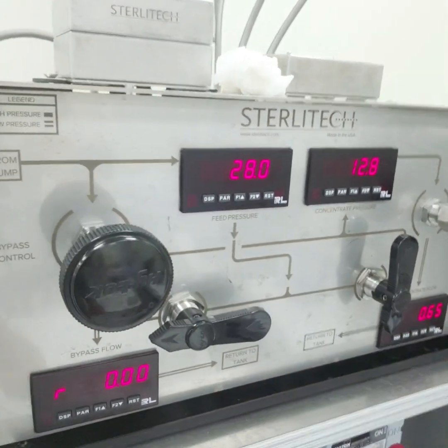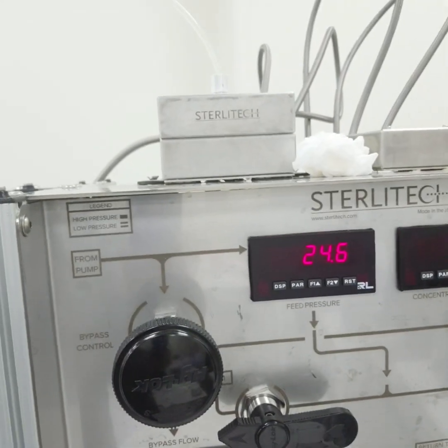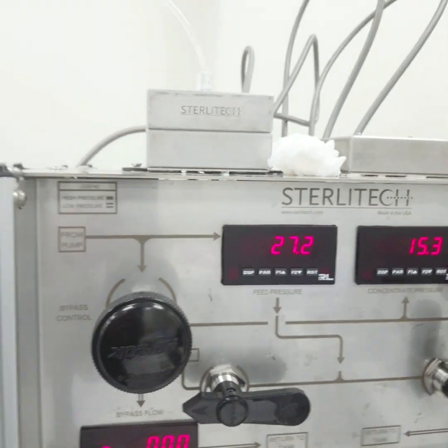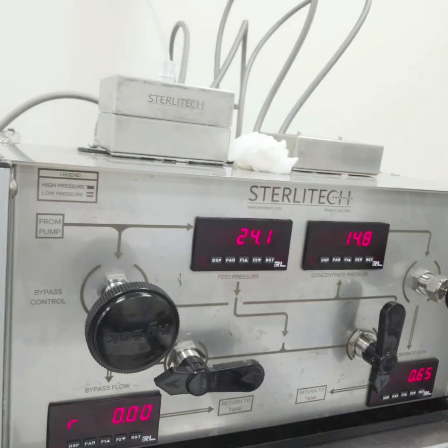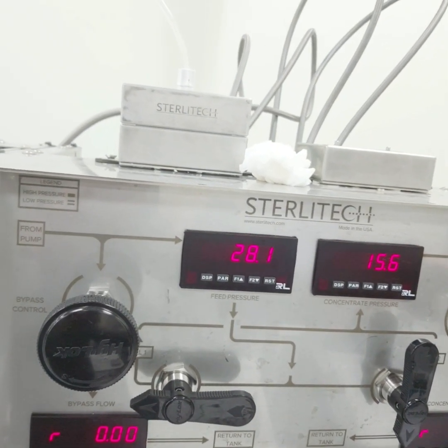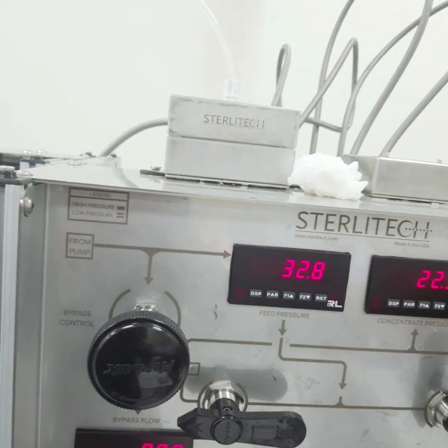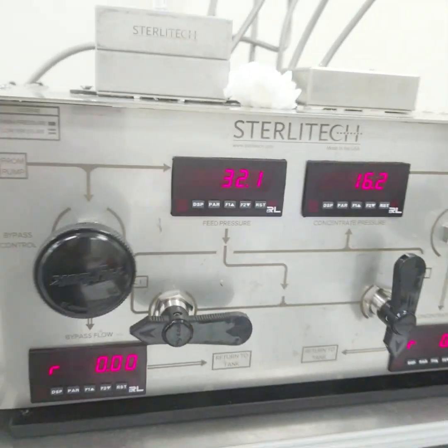And here you can see there are two digital signals. Here we are operating in psi, so 14 psi is equal to 1 bar. Now we are operating at 2 bar, which is equal to 28 psi. From here we are not operating this module, so we are controlling the flow through here. If you see, I'm rotating this way, so the pressure is increasing, and I will keep it up till 28.